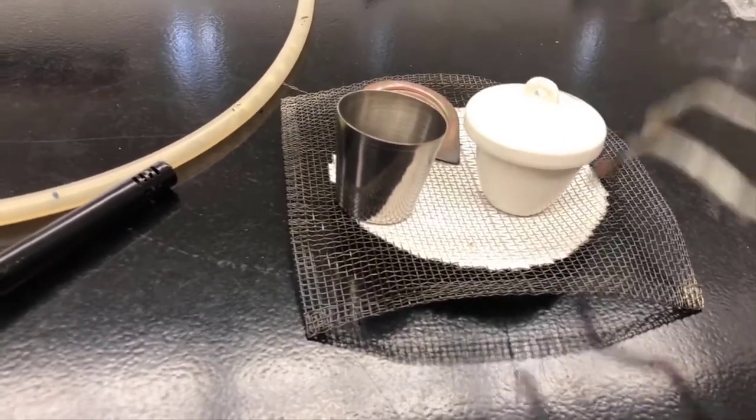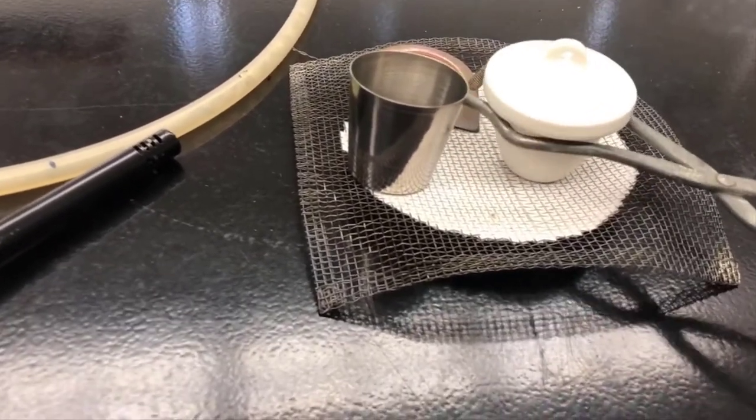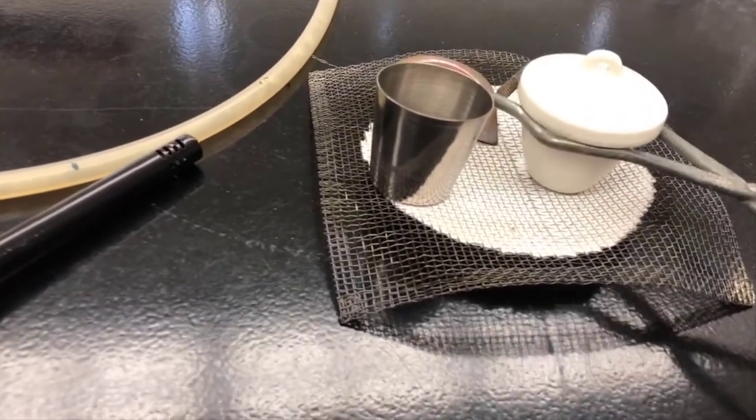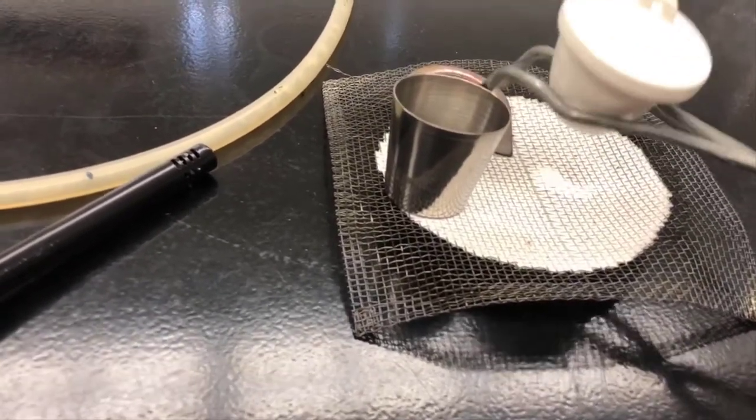Now if you're heating this with the lid on, you're going to grab it right underneath where the lid is. And don't squeeze it because it's still possible for it to slide out like that, because it's a little bit lower when it's like that.